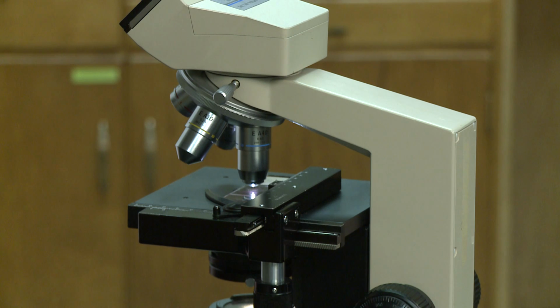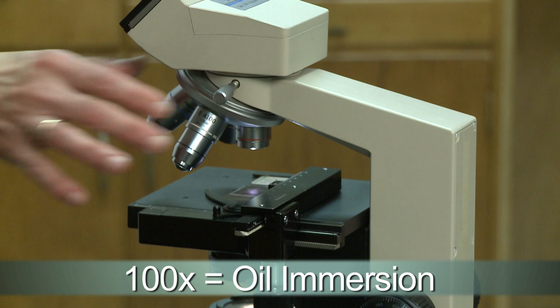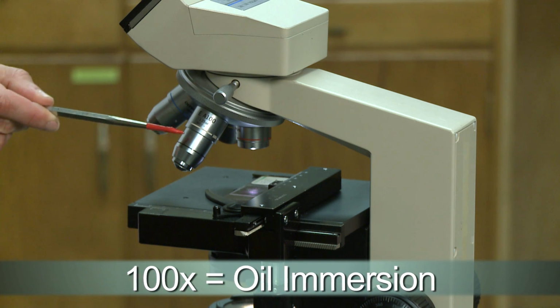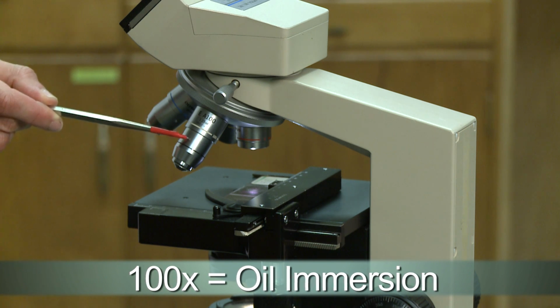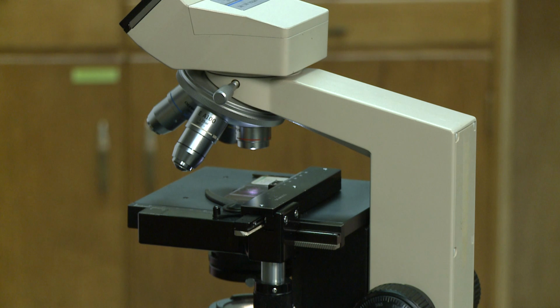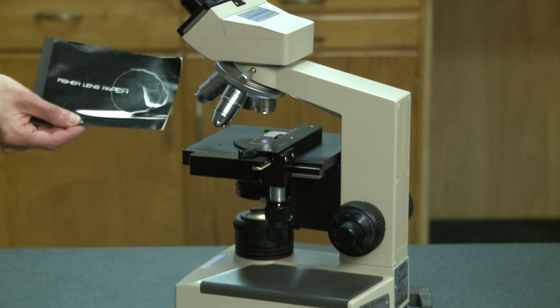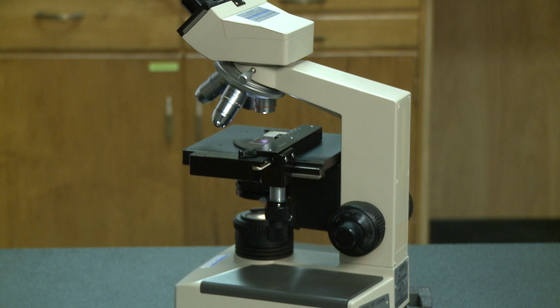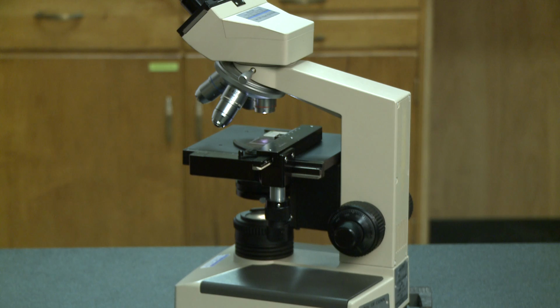The next higher power objective is the 100X objective, which is also called the oil immersion objective. It's very important to never use this objective on your scopes in the lab. Occasionally, the lab staff may set up a demo slide that requires oil immersion using the 100X objective. If this is the case, don't switch to another objective or the oil will be transferred to the other lenses. If you do need to clean the lens, please be sure to ask your instructor for special lens paper. Only this lens paper should be used to clean the lenses with, as any other paper product like a Kim wipe or a paper towel can scratch the lenses.